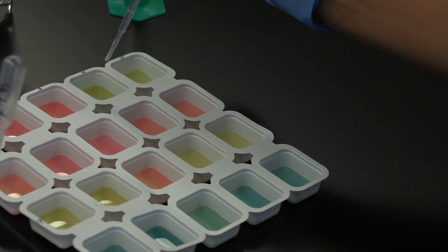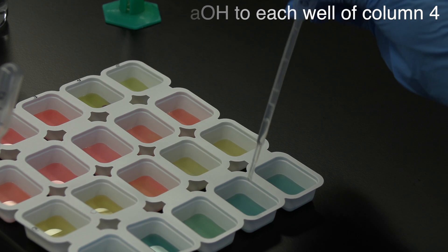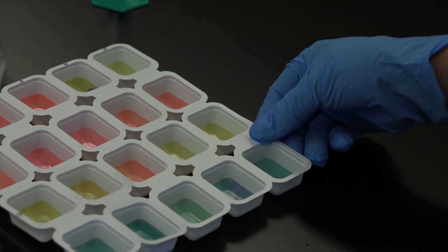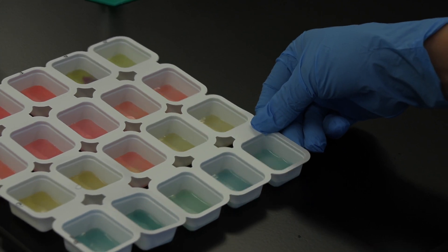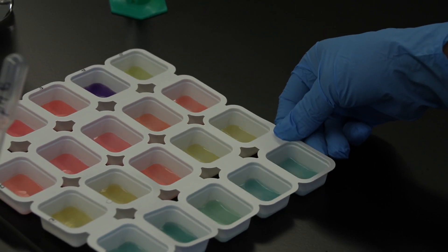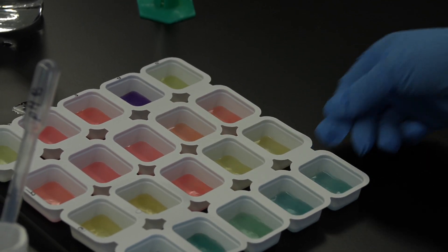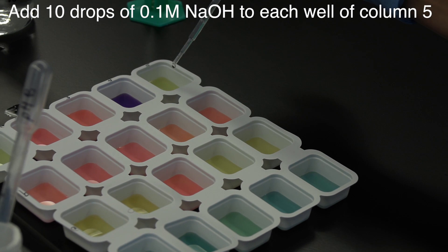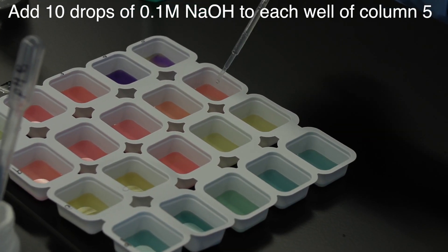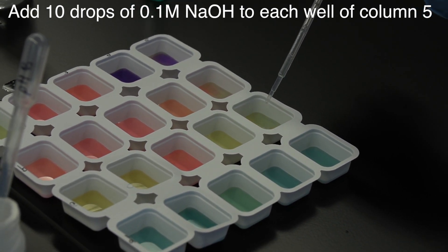In the fourth well of each row, column 4, add one drop of 0.1 molar sodium hydroxide. Gently swirl the solution while resting the tray on the table and record the pH of each solution in data table 1. In the fifth well of each row, column 5, add 10 drops of 0.1 molar sodium hydroxide, again recording pH in data table 1.